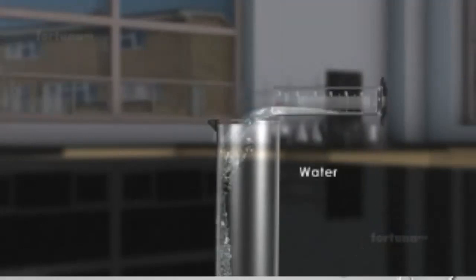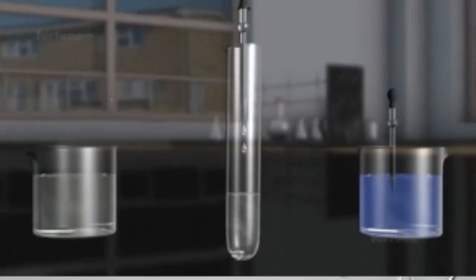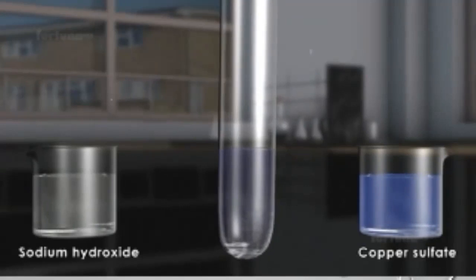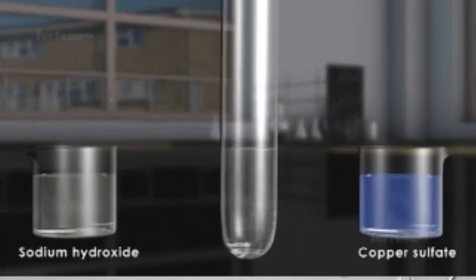We can test plain water for proteins. Pour 4 milliliters of water in a test tube and add a few drops of dilute sodium hydroxide solution. Add 3 drops of copper sulfate solution. Gently shake the test tube and observe the mixture does not change color. This indicates the absence of proteins in plain water.